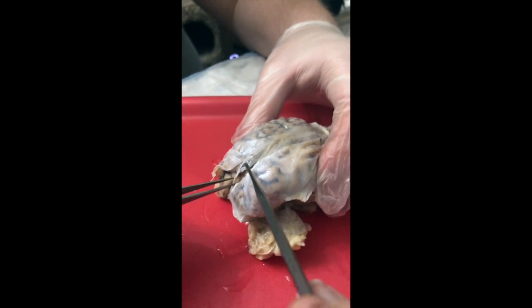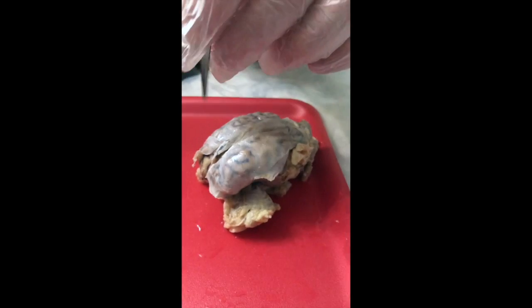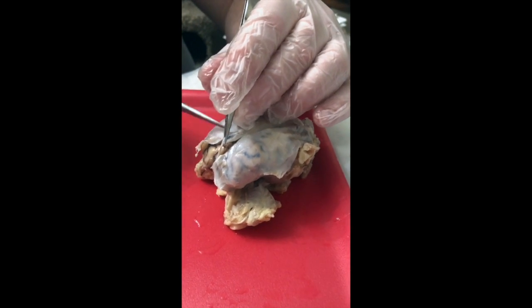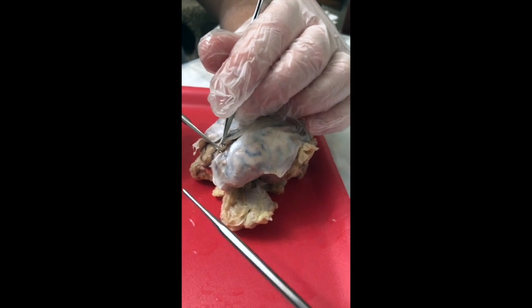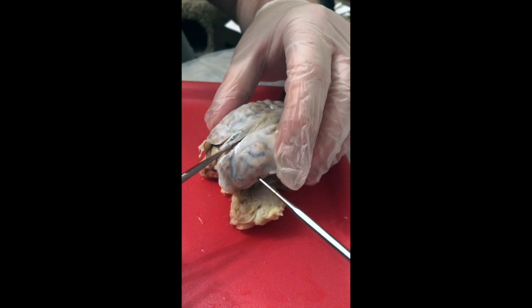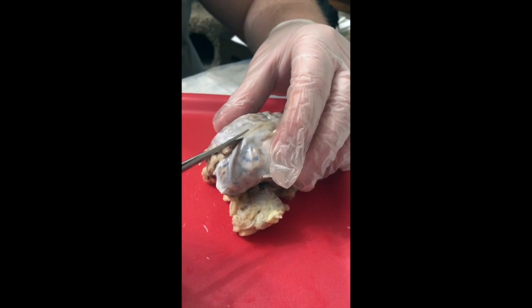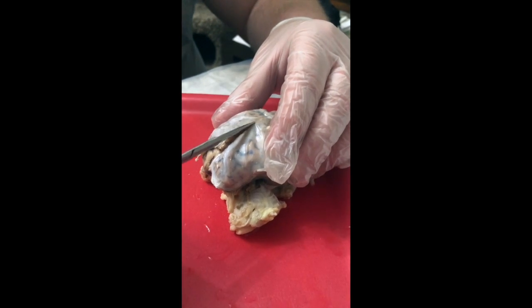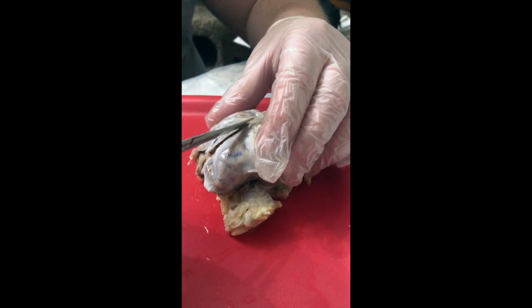So in order to see anything else, first thing we need to do is cut off the meninges. So we're going to slide scissors into that subarachnoid space, taking care to only cut off the superior surface, and we're just going to cut straight along the sides on either side. We don't want to cut off anything on the inferior aspect because we could pull off some of those delicate structures along the midbrain and brainstem region.